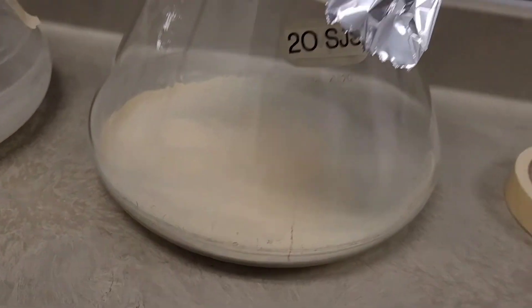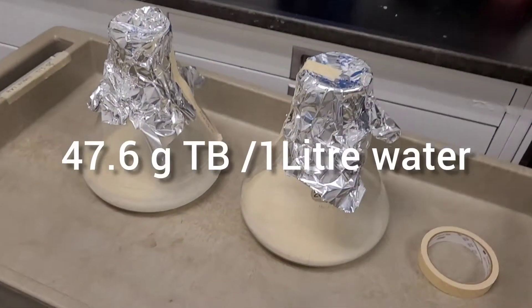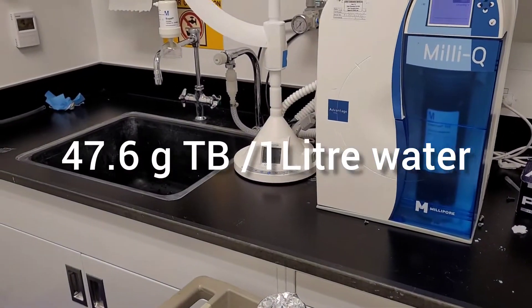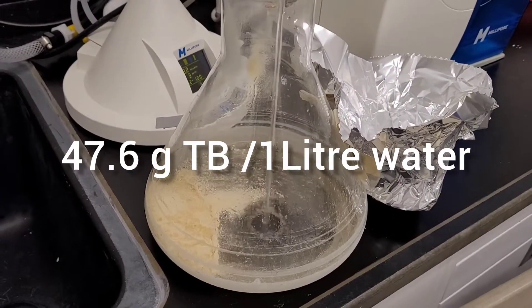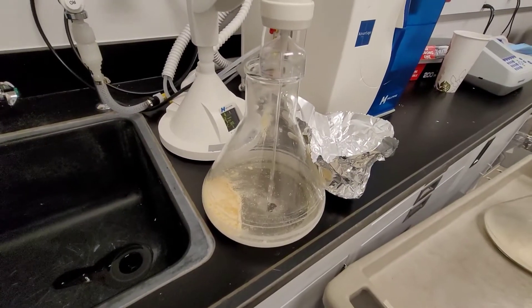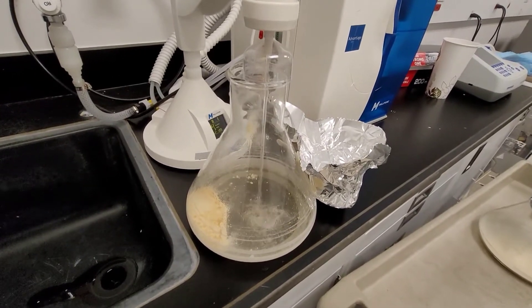Hello, welcome. Today we're going to look at how you can express proteins using bacteria expression such as E. coli.